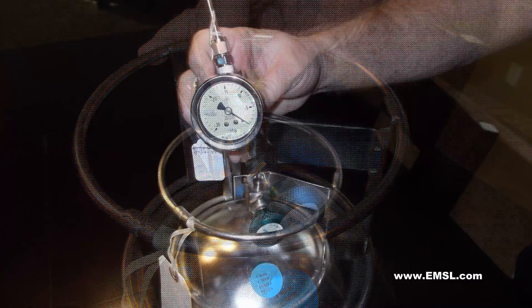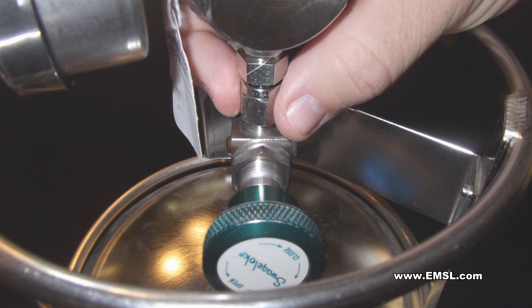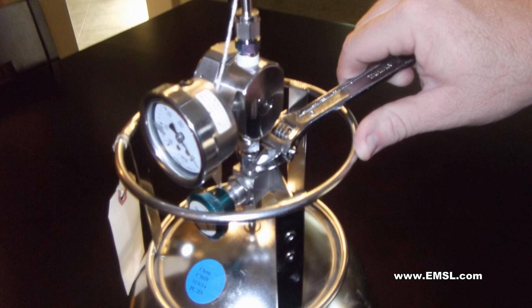Remove the brass dust cap on the canister. Attach the regulator to the 6-liter can using your fingers, being careful not to cross-thread the nut. Tighten until snug with a 9/16-inch wrench only after finger threading.